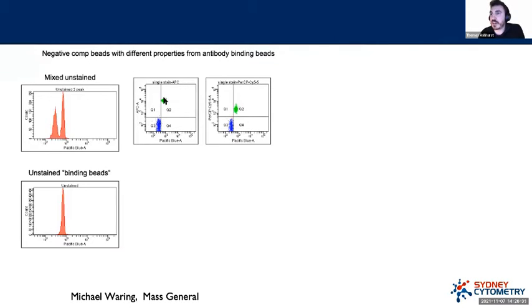These beads in this case are labeled with APC. These are the negative beads. Now, what you can see here is that they are spilling, quote unquote, into the Pacific blue channel. Now, this is actually not true. This APC signal is actually not spilling into Pacific blue. The autofluorescence of these beads is higher in this sort of violet region channel, about 440 nanometers. And so this isn't actually showing us that APC is spilling over. This is actually just the beads are higher in that channel natively.